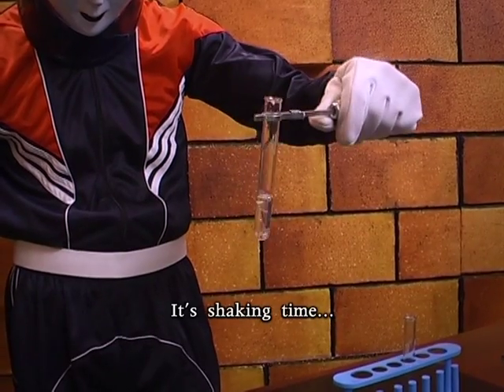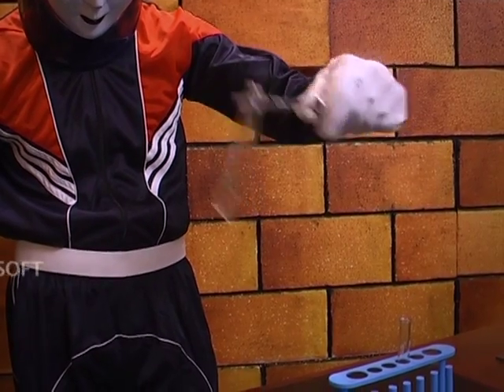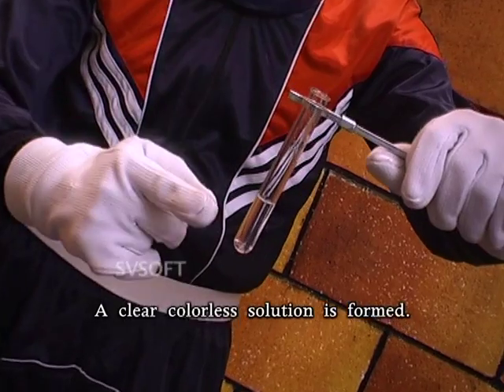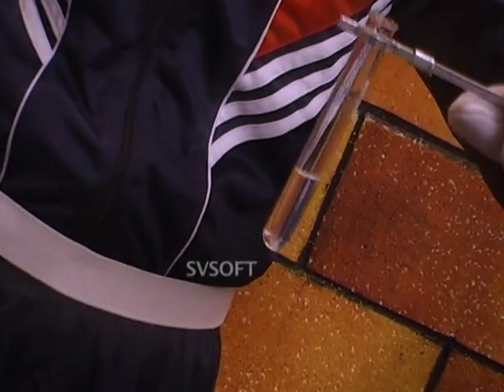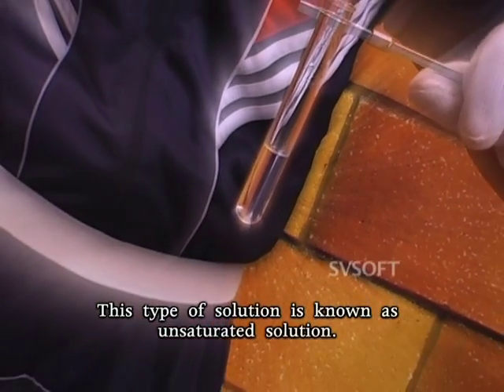It's shaking time. Observe friends, a clear colorless solution is formed. This type of solution is known as unsaturated solution.